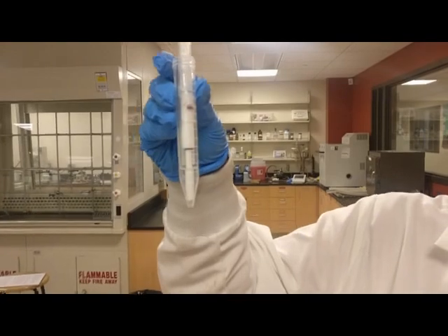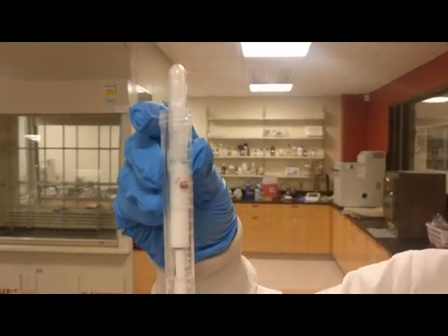After centrifuging, you can see that the liquid is at the bottom of the tube while our crystals are at the top.